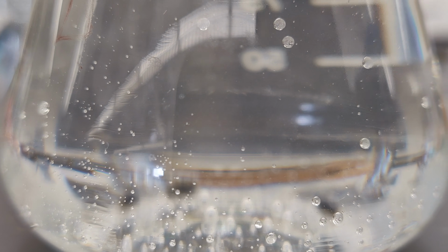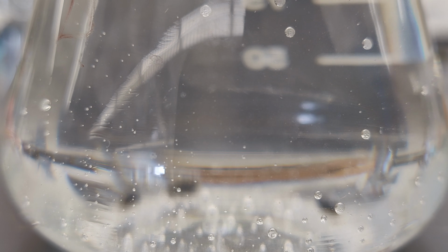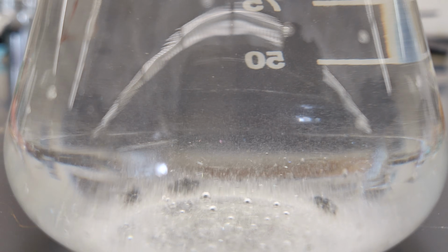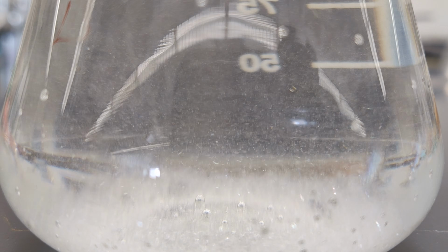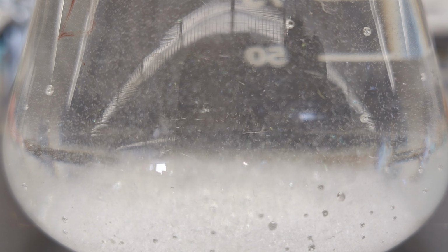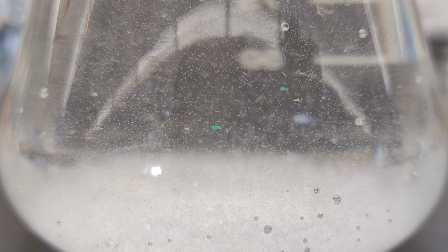As the hot liquid slowly cools, crystals of cinnamic acid will slowly and selectively recrystallize from solution, since it is much less soluble in water than urea, the other organic solid in the original mixture you began with. Over a period of 10 minutes, speeded up approximately 10 times in this video clip, you can watch the crystals of cinnamic acid slowly emerge from solution and then gradually settle to the bottom of the flask.